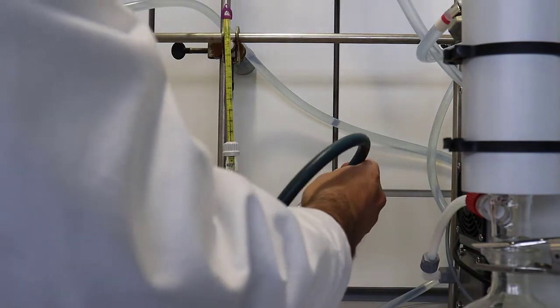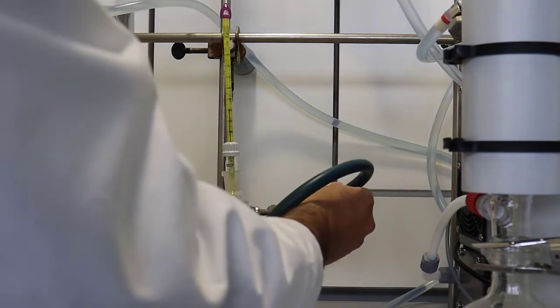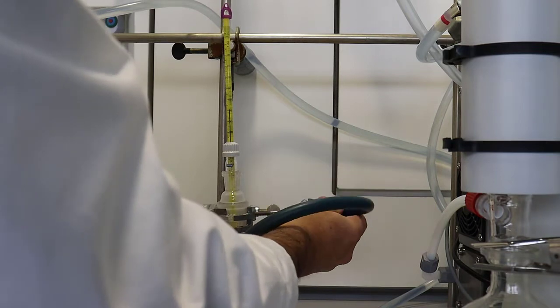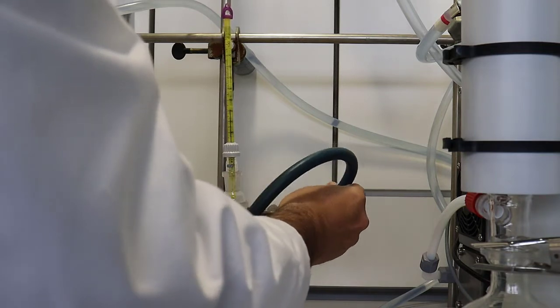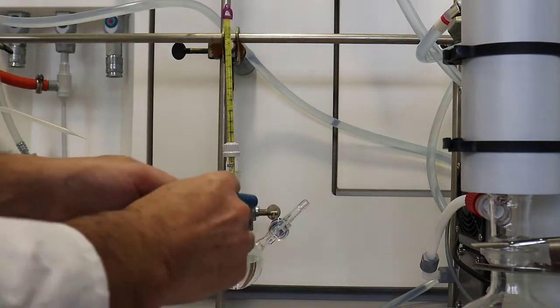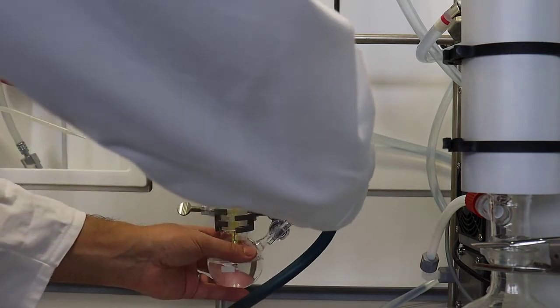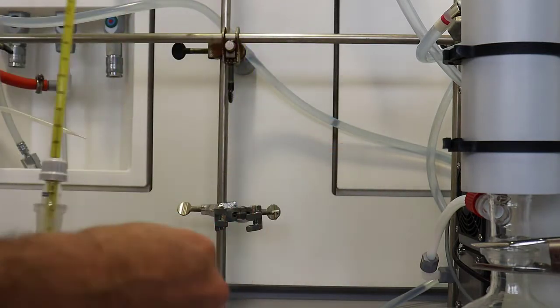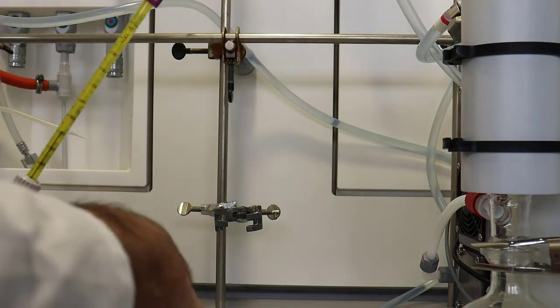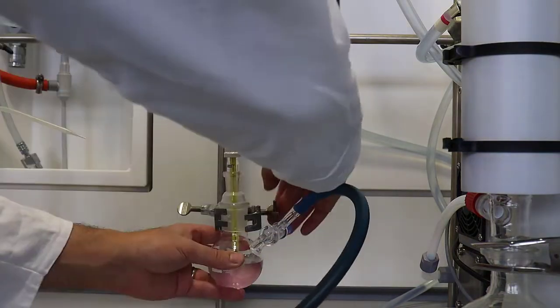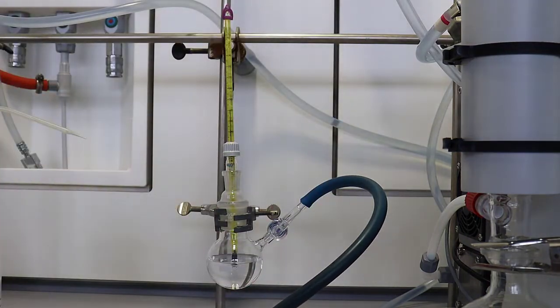I'm going to connect it now to a vacuum pump so that we can change the pressure inside the flask. Sorry you can't see it, I was standing at a bad angle. It's also very difficult to do. So we will fast forward and see me having done that. And here we are back.